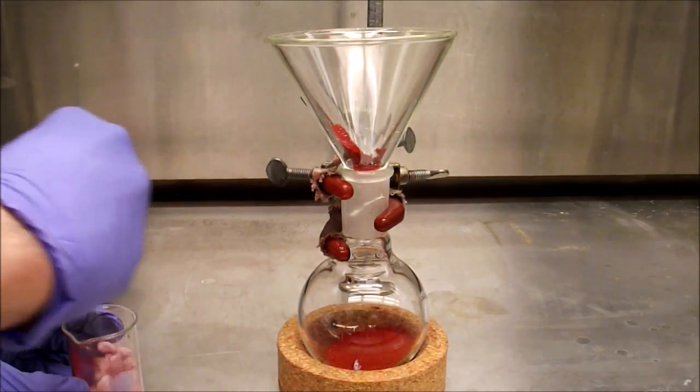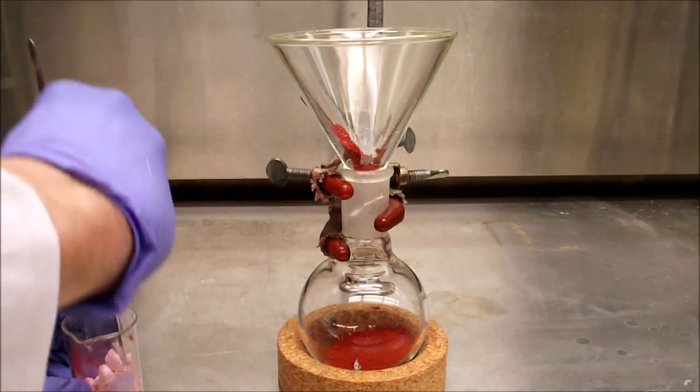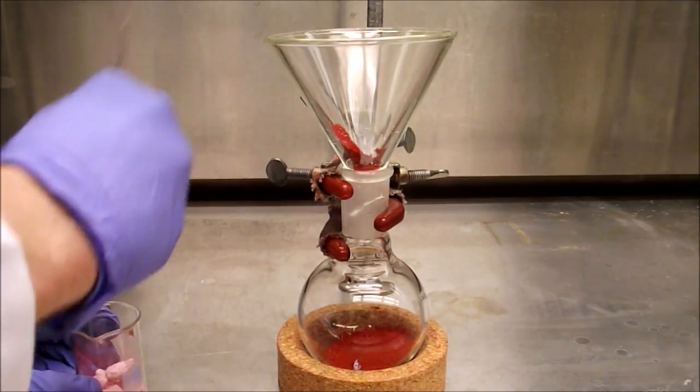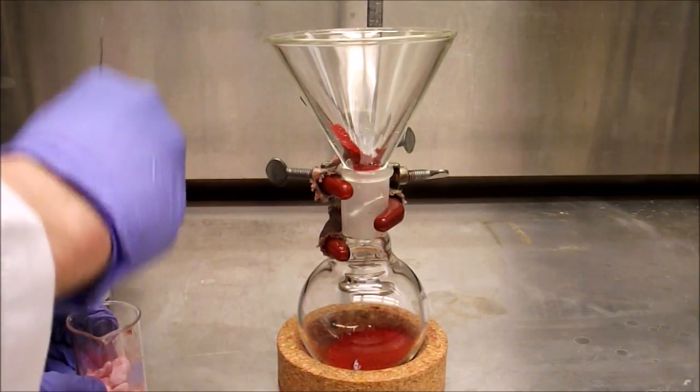This is likely what's causing it to be slightly pink. Since the most likely impurity is the same as our product, it is not a concern to have a small amount of contamination.